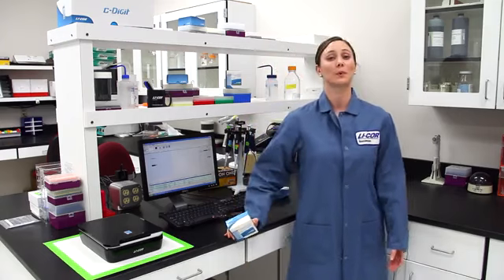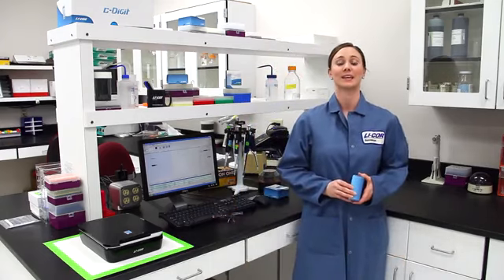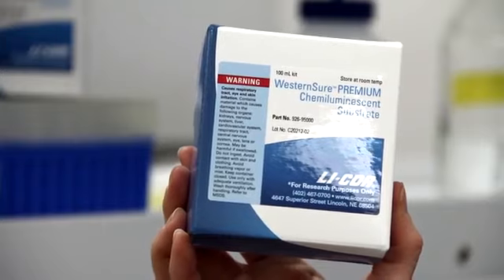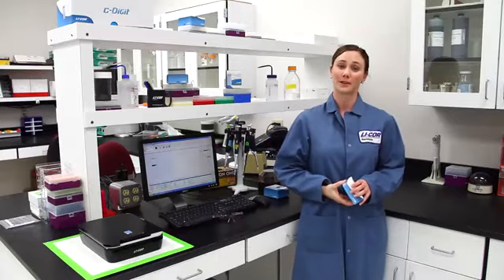And if you normally expose your blot to film for longer than ten minutes, then I recommend WesternSure Premium Substrate or SuperSignal West Femto for the best results.